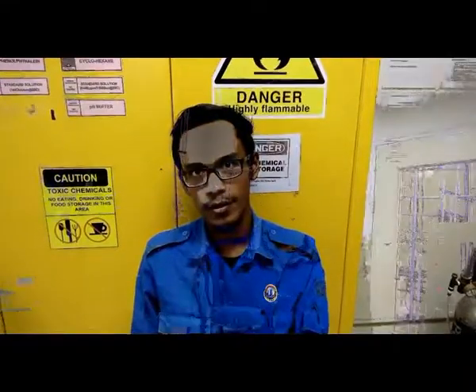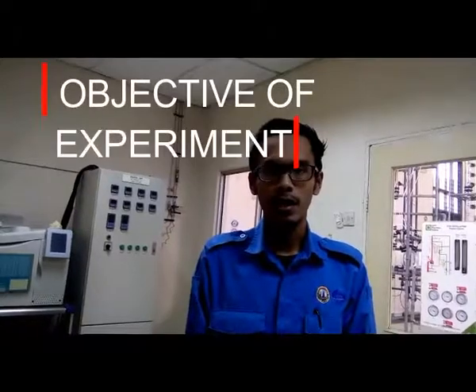Okay, for the objective of the experiment, the first objective is to run the operation of filter press for filtration of calcium carbonate slurry. The second objective is to record the data of filtrate volume against time. Third is to find the time when the filtrate volume is the lowest. Fourth is to determine the filtration time to completion. And the last objective is to determine the loss quantity of calcium carbonate after the filtration process.